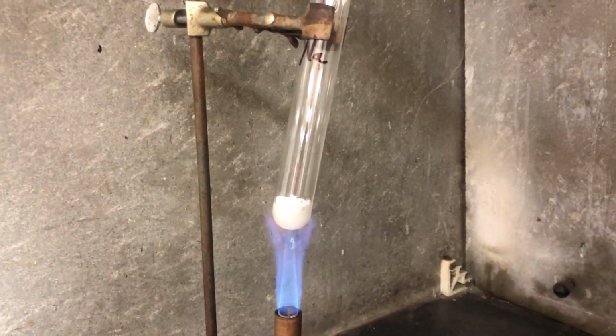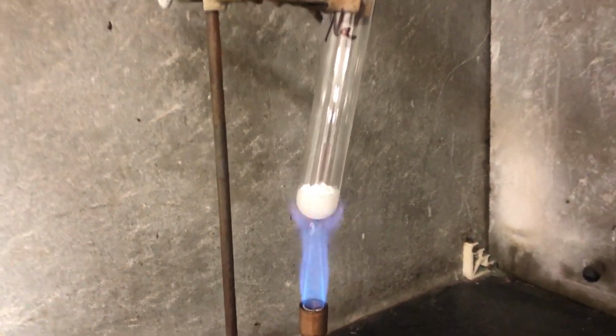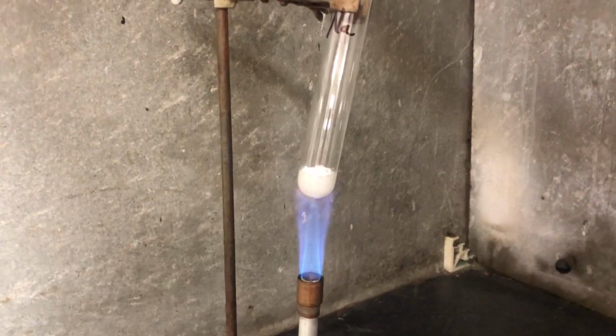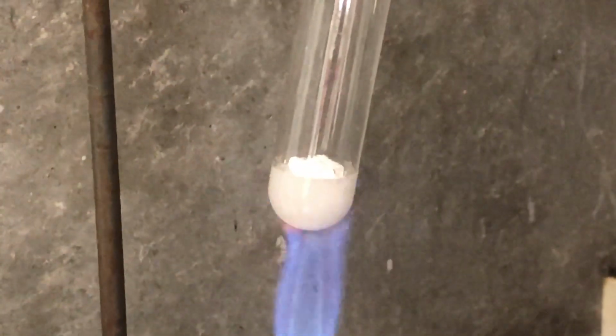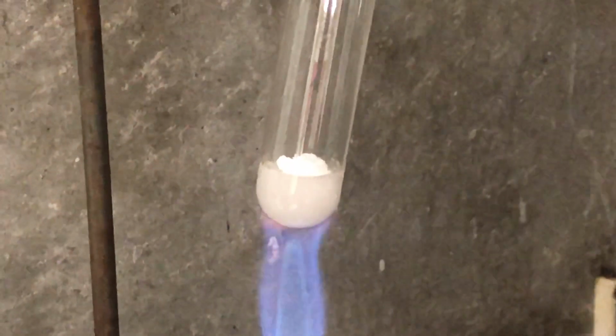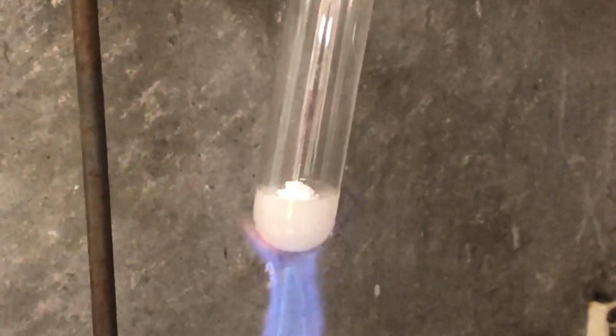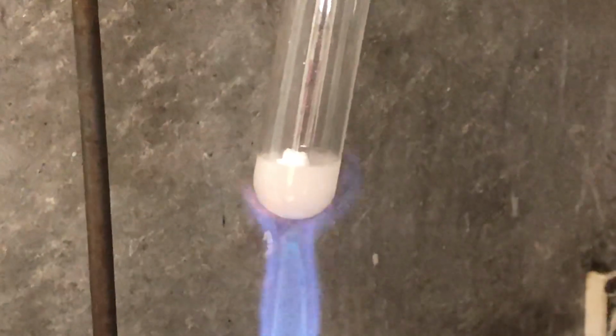And this one may be occurring a little bit slower, which I don't know. I don't know if you can see that or not. When I noticed it, the compound did have a little bit more moisture in it. So I don't know if it's due to the age of the compound or not, and how many times it's been opened. But you do see bubbles starting to form. You do see some of the same evidences that the previous one had.